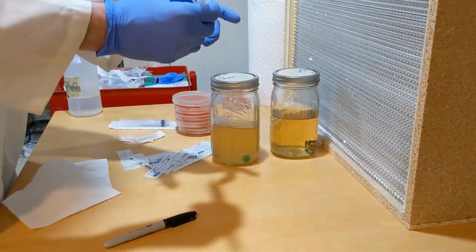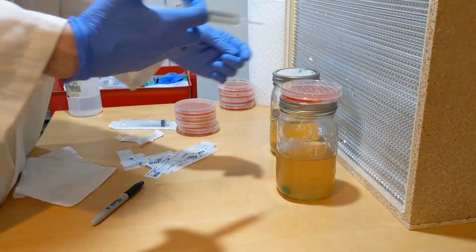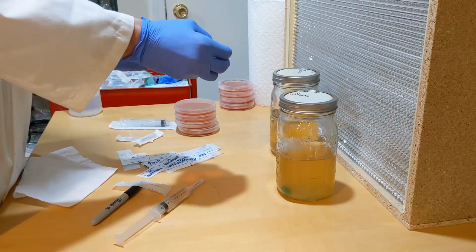Just gonna finish labeling everything, labeling the plates, wrapping them up, and gonna clean my bench.